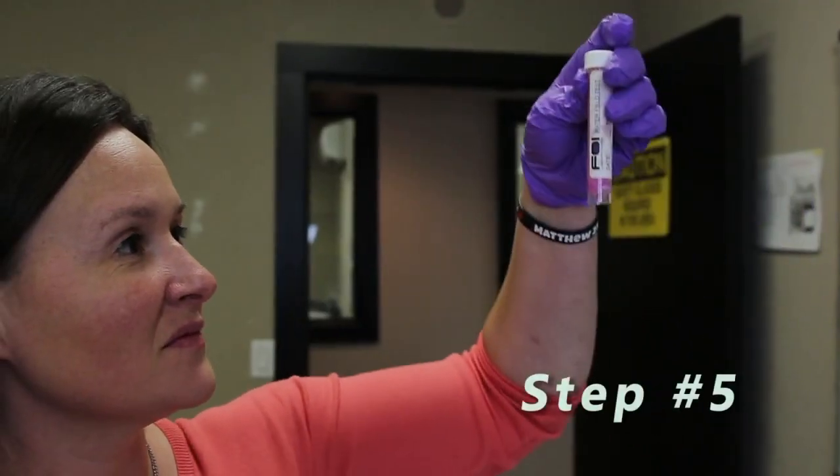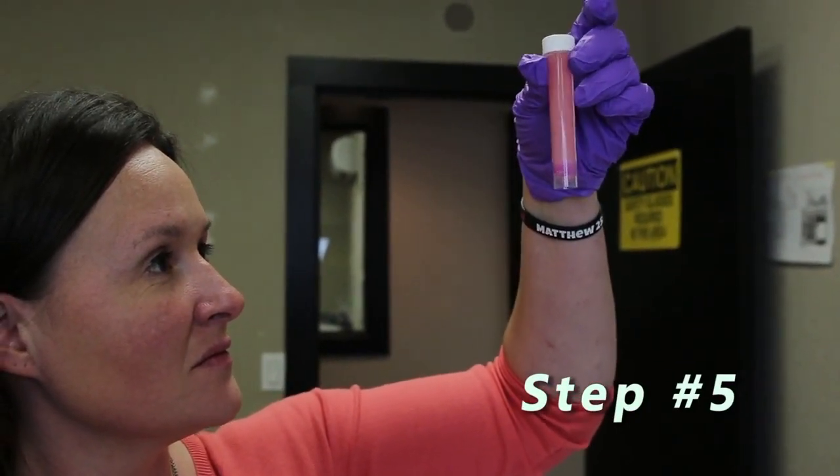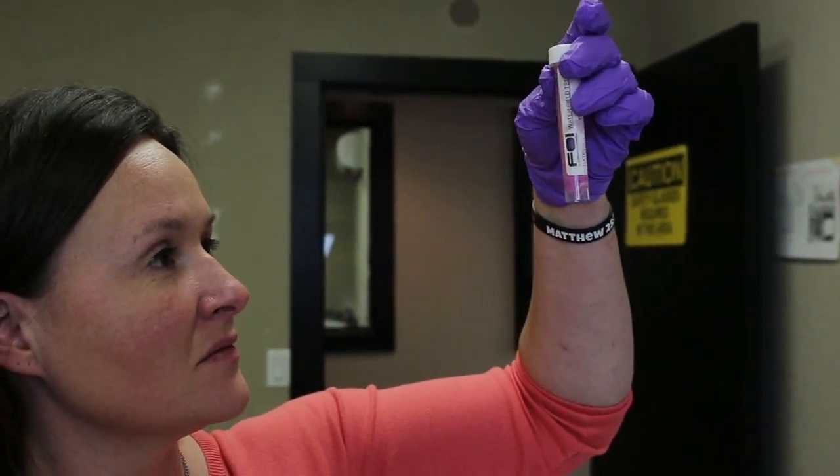Step 5, holding the bottle upright, inspect the contents at the bottom of the tube.